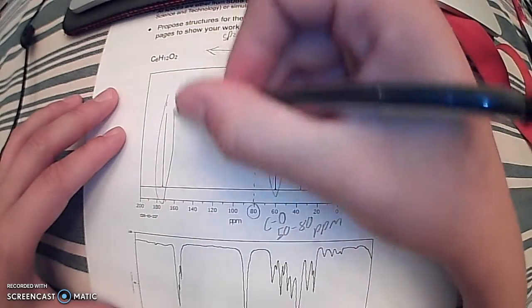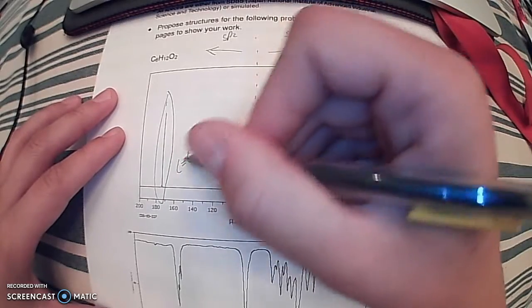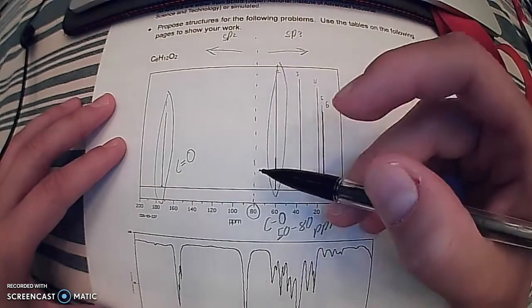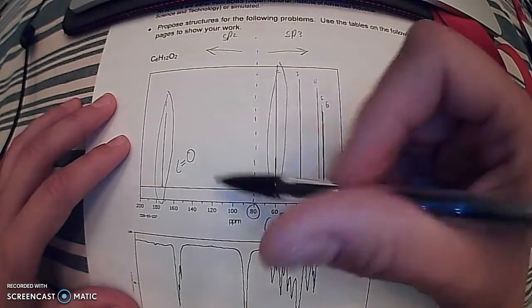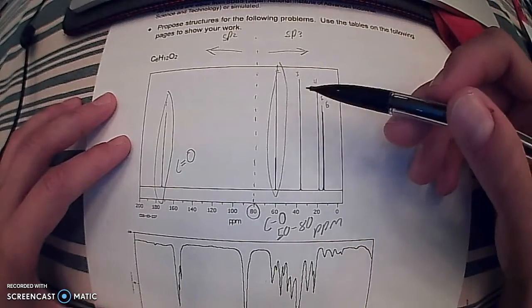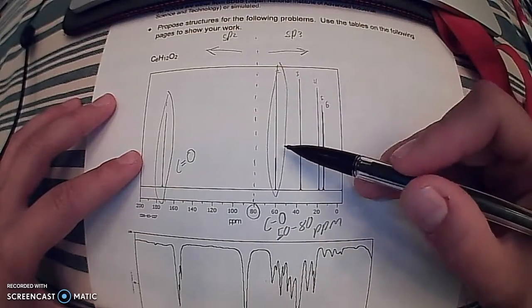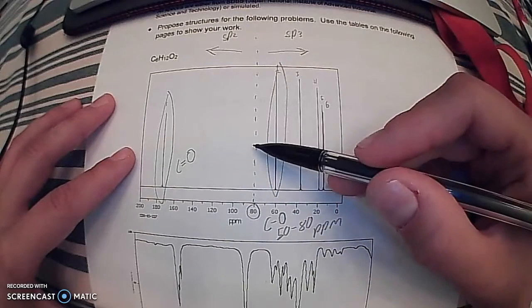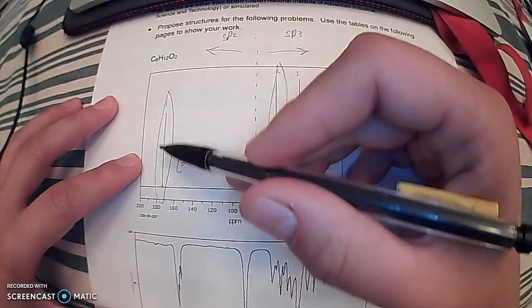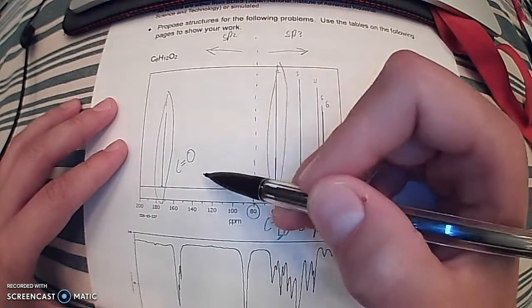And then this peak, our first peak here, is going to be our carbon to oxygen carbonyl, or double bond. One can tell this based on previous knowledge of the spectral data in terms of electronegative atoms, which is going to be our oxygen here and our oxygen here, which most greatly affect the shift. So with the carbon to oxygen single bond, it's still in the upfield region, but it's going to shift downfield because of the pull of the oxygen. And our carbon to oxygen double bond is going to be way down here in the higher parts per million range, very downfield, again due to that very electronegative pull.